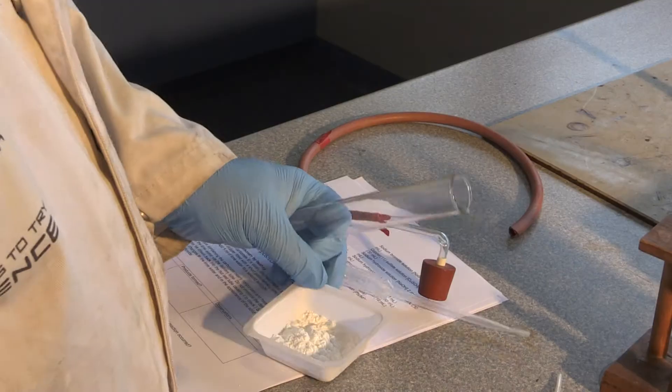This first station is the decomposition of magnesium carbonate. We're going to take a test tube of magnesium carbonate and heat it under the Bunsen burner and look at what happens visually. It's not super exciting, so we'll do a couple where we speed it up so you'll hopefully see the change happen a bit quicker, but we'll also make sure we film the other evidence that occurs.